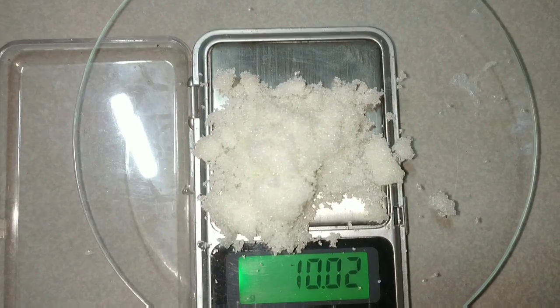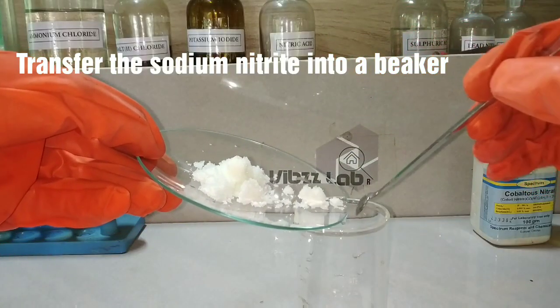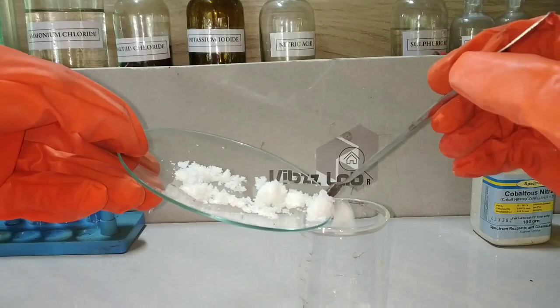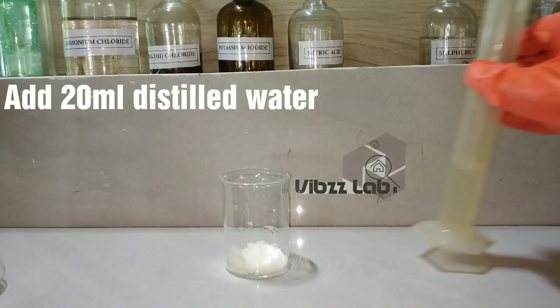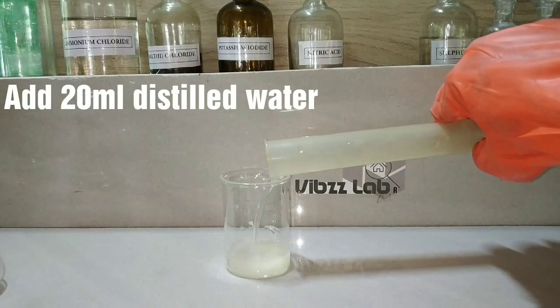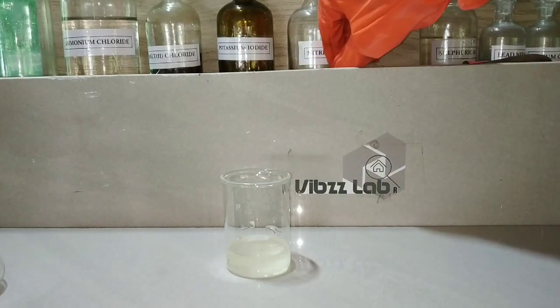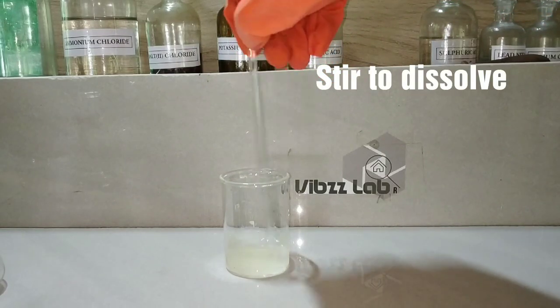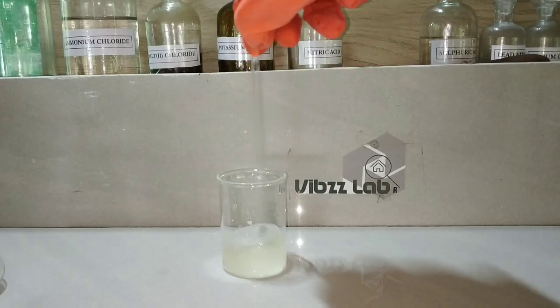We transfer the sodium nitrite into a beaker and dissolve the salt in 20 milliliters of distilled water. The dissolution of sodium nitrite is endothermic in nature, which means the temperature drops down on dissolving the salt.